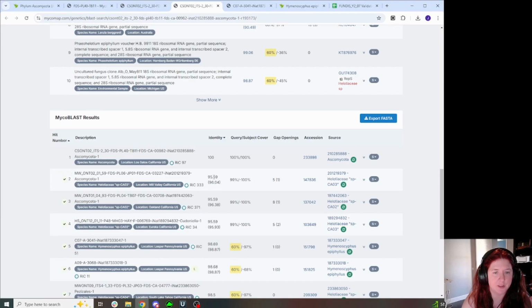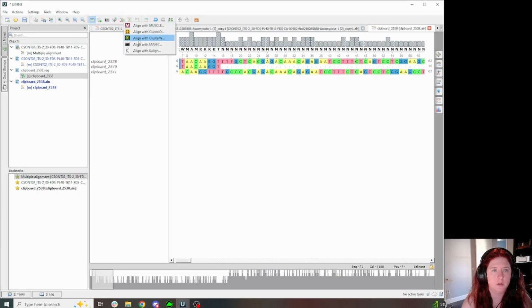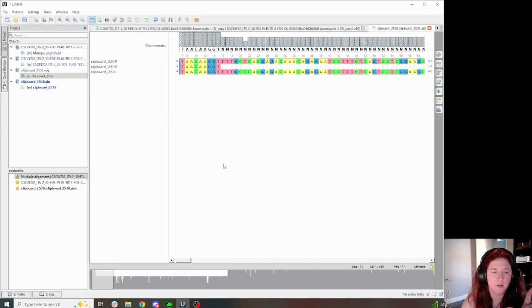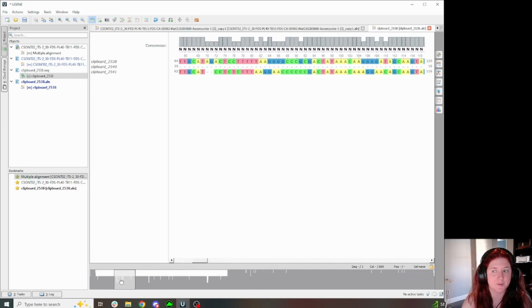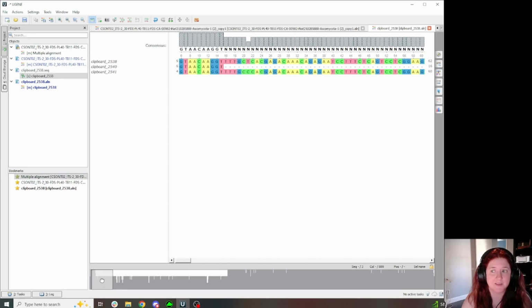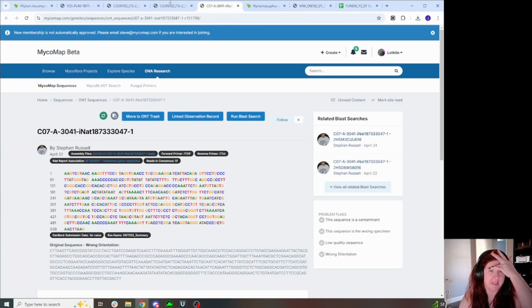And actually, yeah, if you look, there is this one, which aligns better. And I bet these are going to have that group 1 intron. So even though they're only about 96% similar, yeah, see, this group has the group 1 intron. So it's interesting, right?